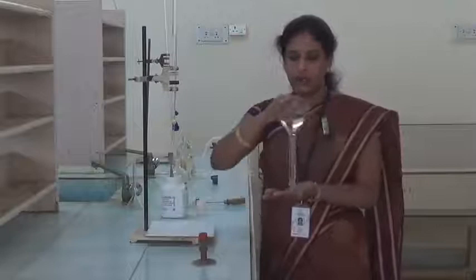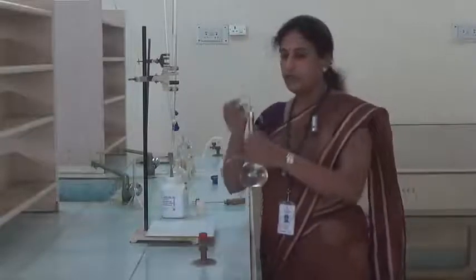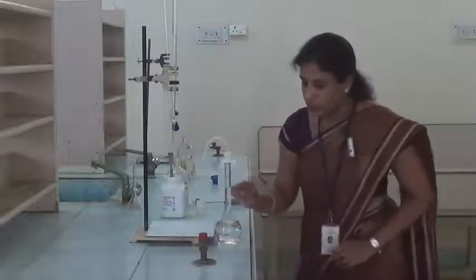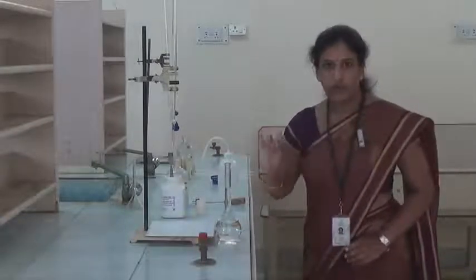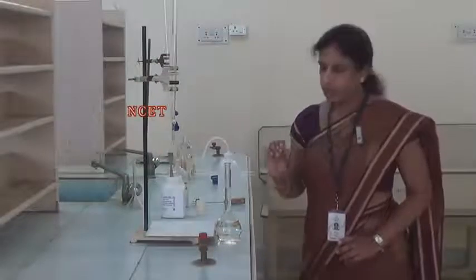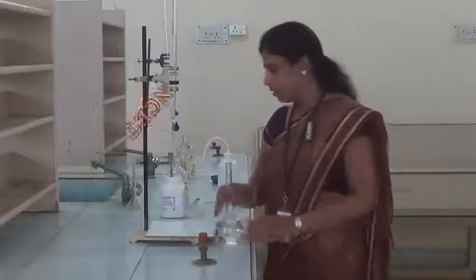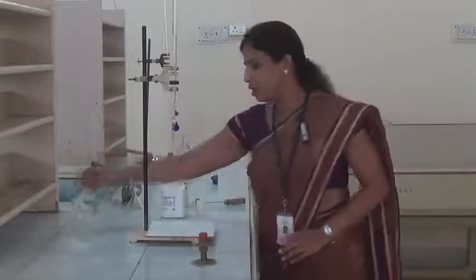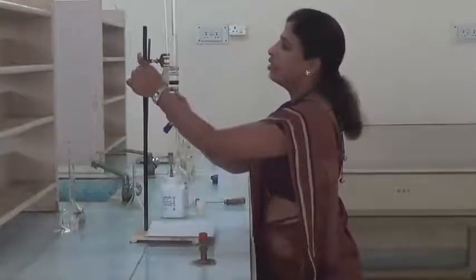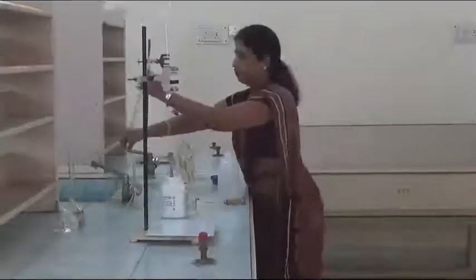After mixing the solution, then we have to remove the lid. So before adding water up to the mark, we should not fix the lid at all. This is very important. And suppose while mixing, if you lose the solution, then you should not add the water. Then keep the standard solution a little bit inside and then remove the water which is there in the burette.